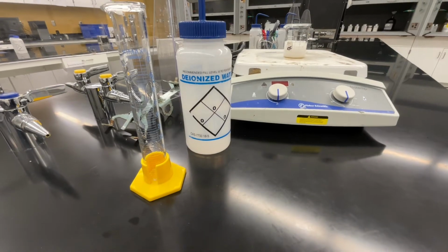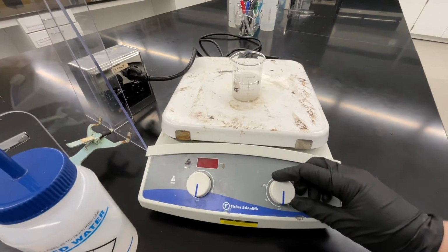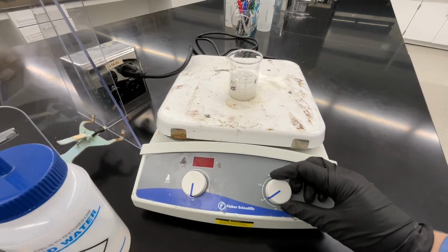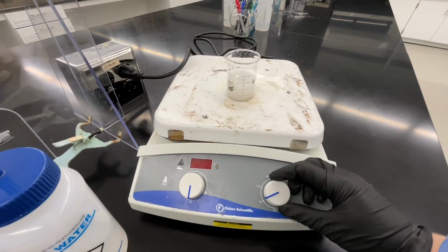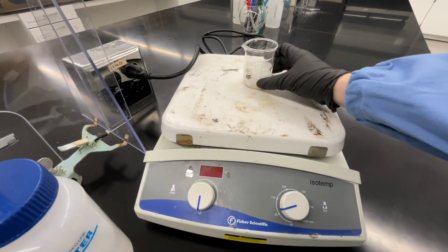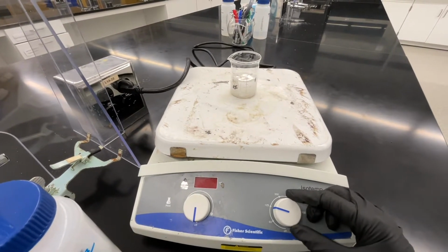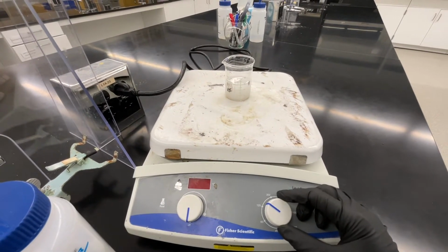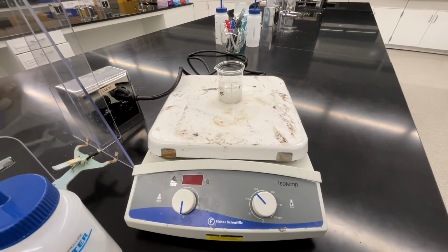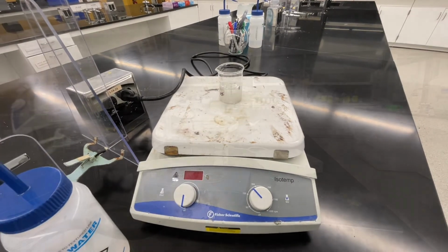A stir plate is a convenient piece of laboratory equipment that allows us to stir mixtures using a magnetic stir bar. Place your beaker near the center of your stir plate and then slowly turn the knob to activate the stir. As you do this, you may need to recenter the beaker. The stirring works best when the beaker is right in the center so that the magnet is lining up with what's in the stir plate. Gradually increase the stirring speed to a fairly rapid stir. You're going to stir this mixture for 2 minutes.